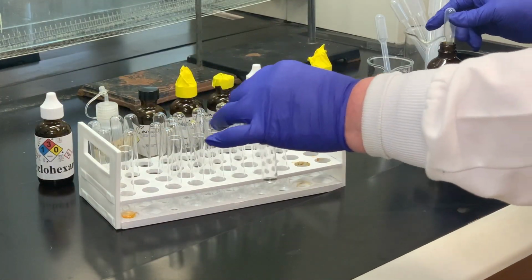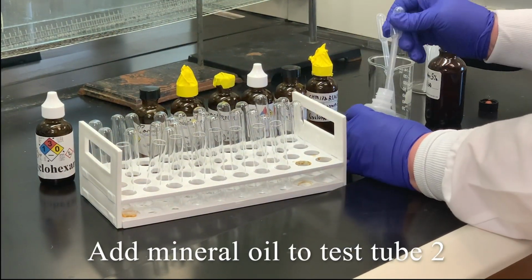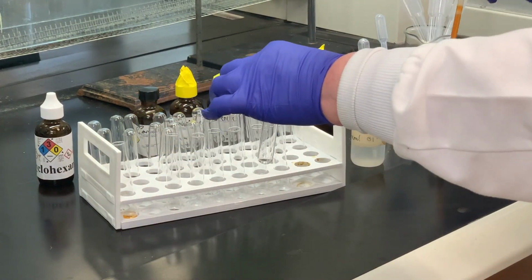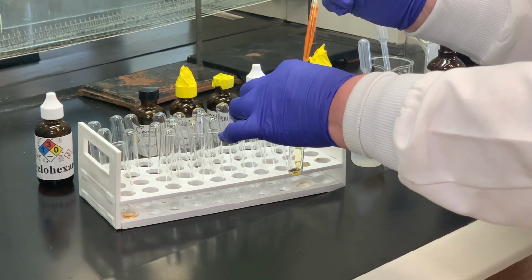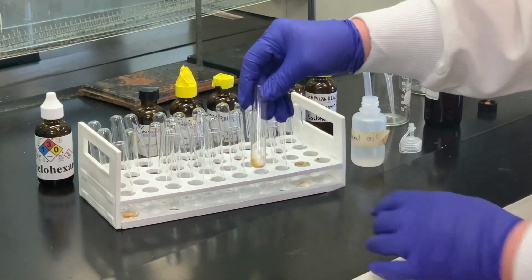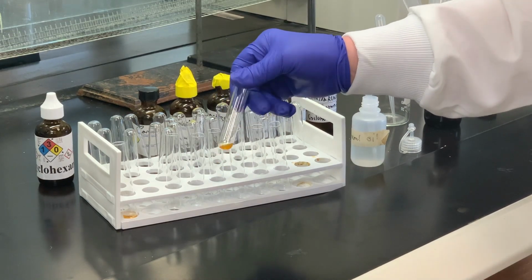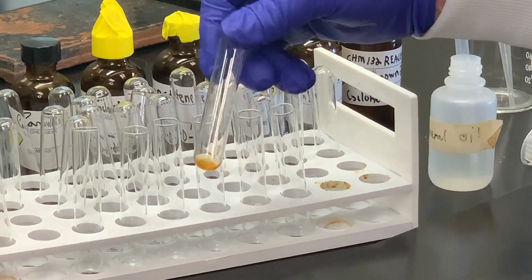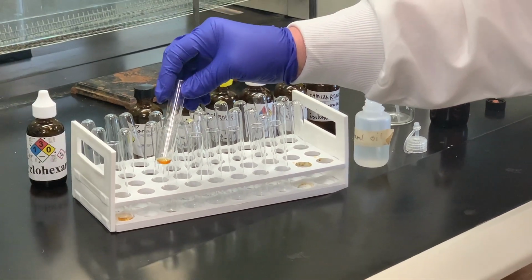Into the second test tube, I'm going to add some of the mineral oil. And then I'm going to add some of the bromine, a couple of drops of the bromine. And as you can tell, there's still that orange color that's present. So we're going to consider that no reaction, meaning no carbon-carbon double bond present.